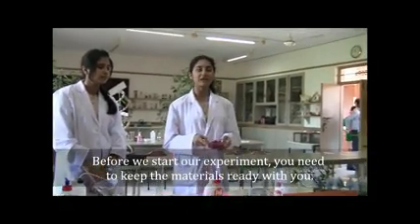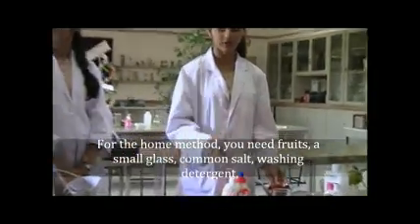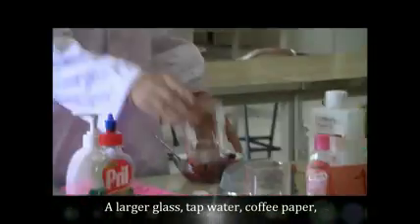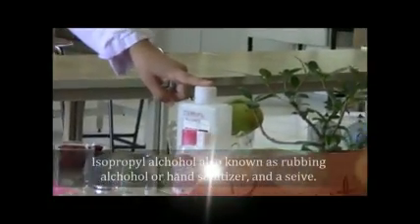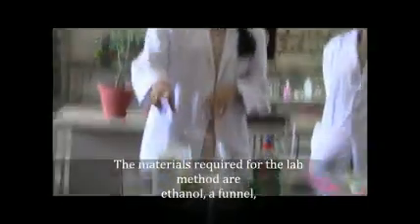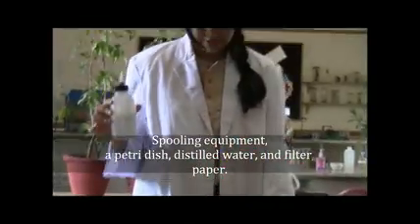Before we start the experiment, you need to keep a few materials ready with you. For the home method, we need fruits, a small glass, common salt, washing detergent or hand wash, a larger glass, tap water, coffee paper, isopropyl alcohol, that is like rubbing alcohol or sanitizer, and a sieve. The materials required in the lab are ethanol, funnel, beaker, washing detergent, measuring cylinder, spooling equipment, a petri dish, distilled water, and a filter paper.